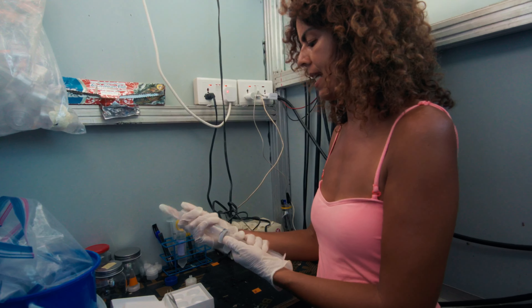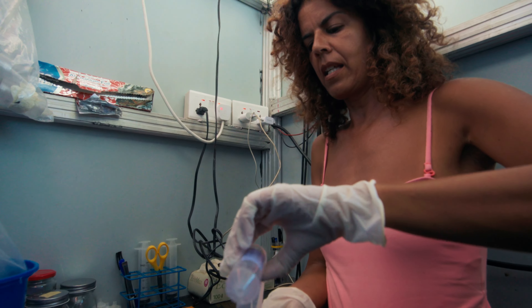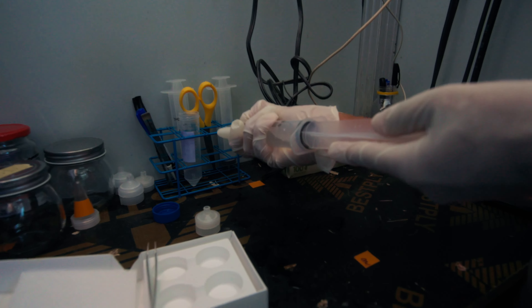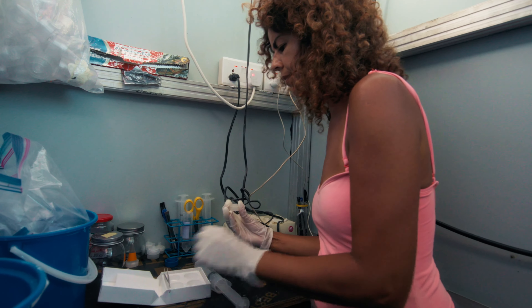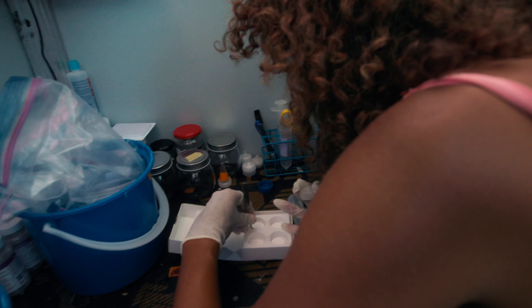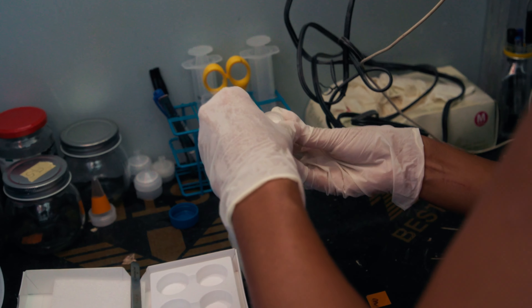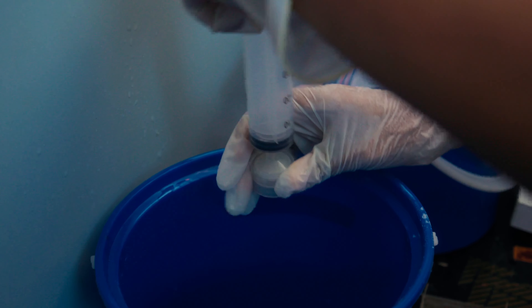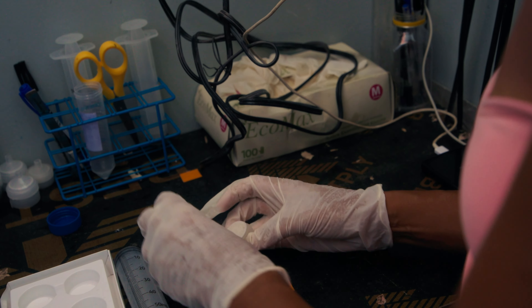We'll be moving and collecting four more tubes of water to run the same tests. This is the lab on the boat where we process the water samples collected in the lake. The samples will go through a filter, be dried, and then we'll take microscopic images to do the counting of the microplastics.